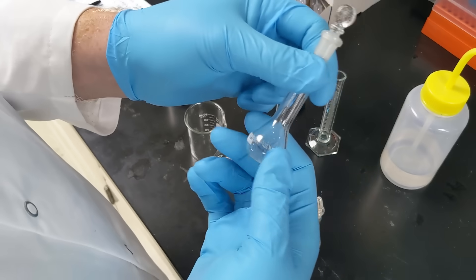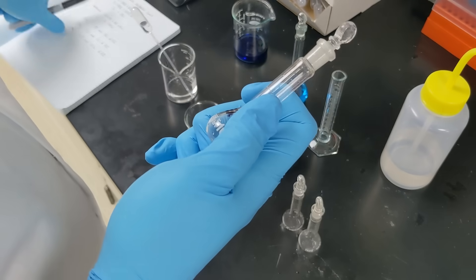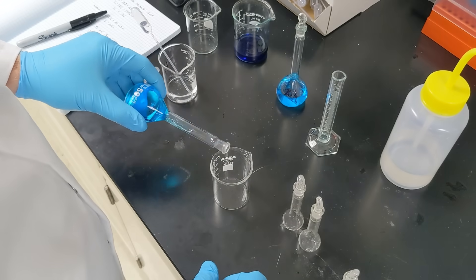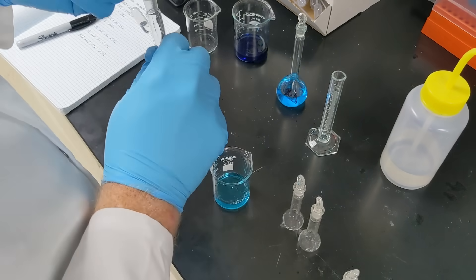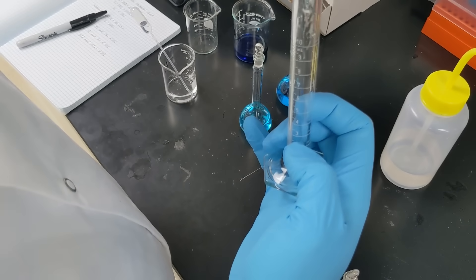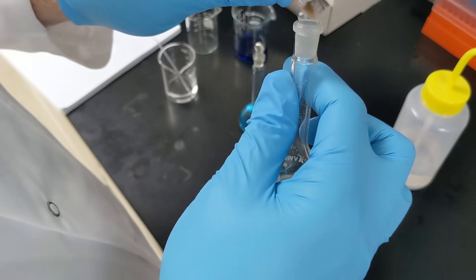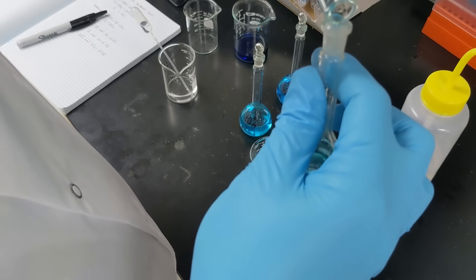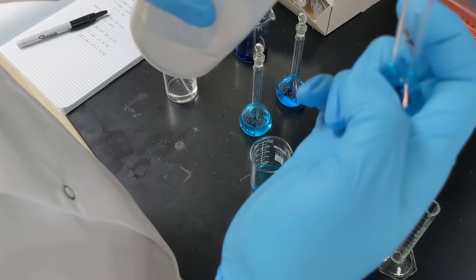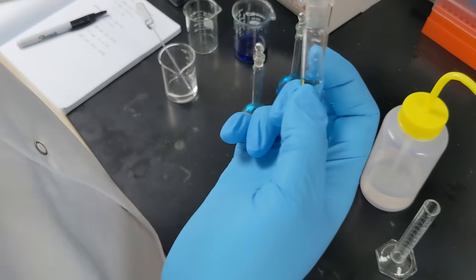The first standard we're going to make is 10 milliliters of 5%. My calculations say I need 5 milliliters of my 10% working solution. I pour the 10% into a clean beaker, measure 5 milliliters into a rinsed graduated cylinder — rinsing between each use to avoid contamination — then pour it into the 10-milliliter volumetric flask. I fill close to the line and top off with the transfer pipette. That's my 5% standard done.